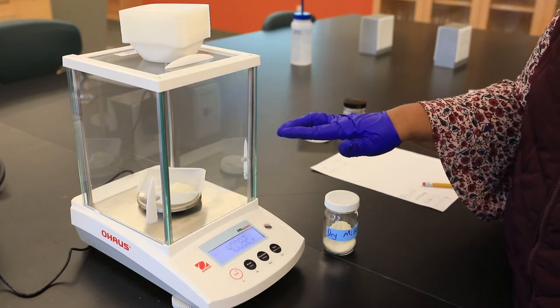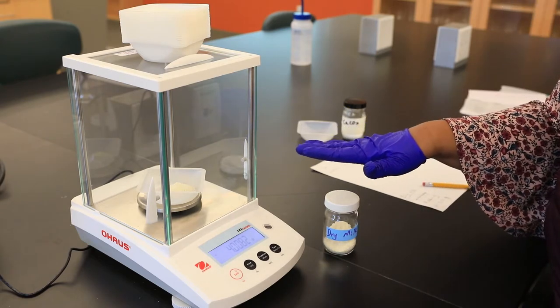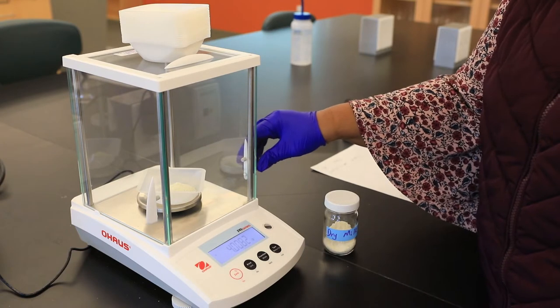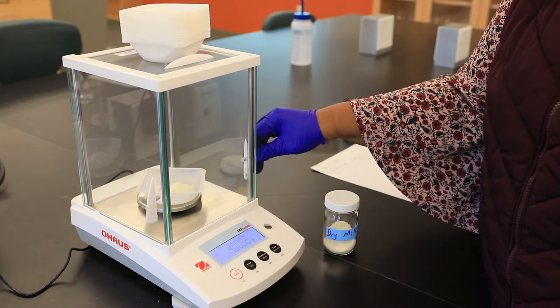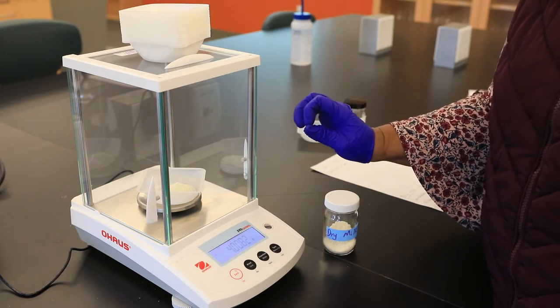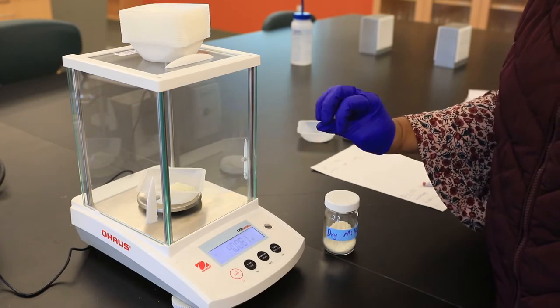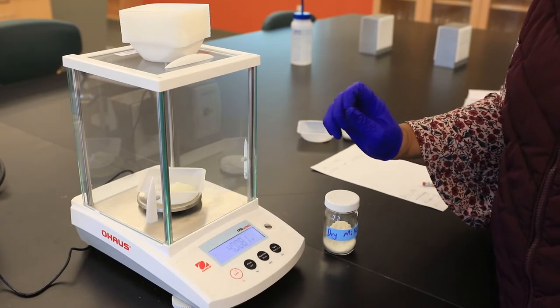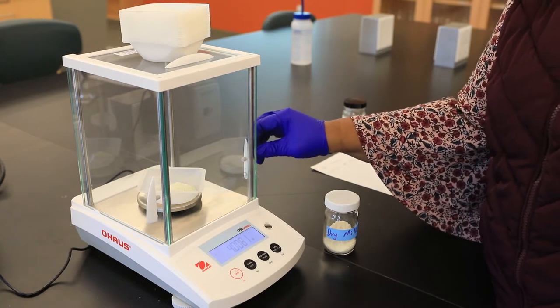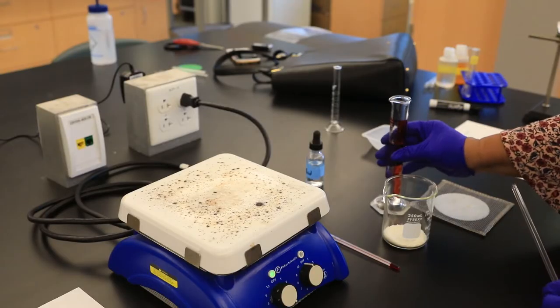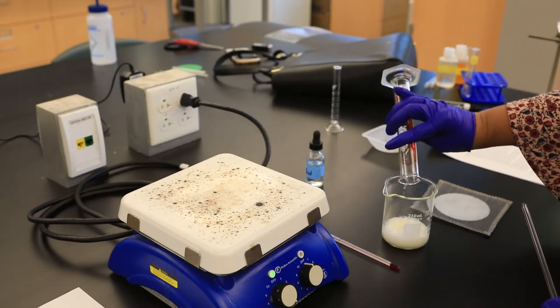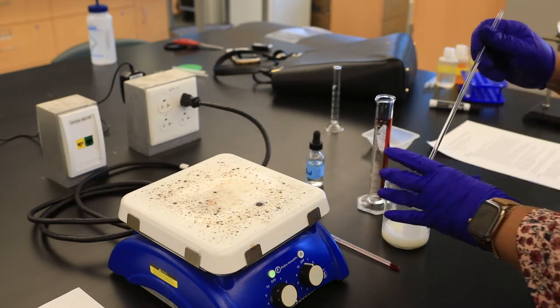I'm going to take it over to our hot plate. I'll initially add 40 ml of water, then place it on the hot plate and try to dissolve it at approximately 40 degrees Celsius.